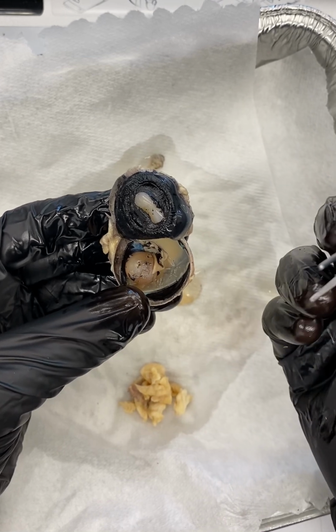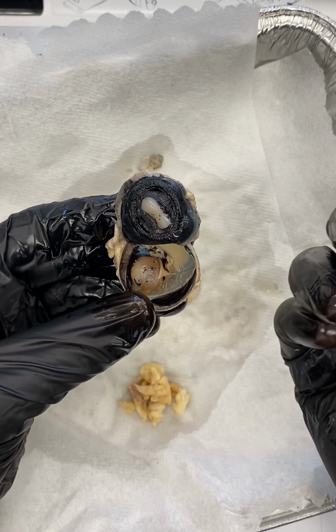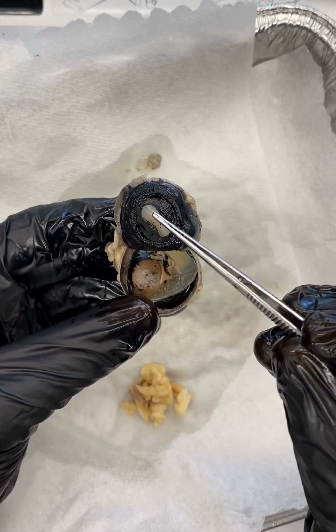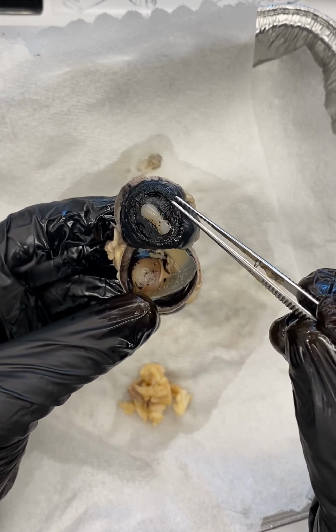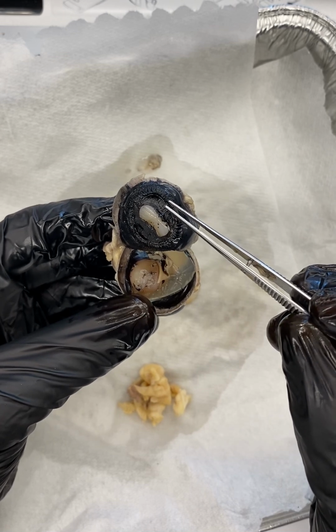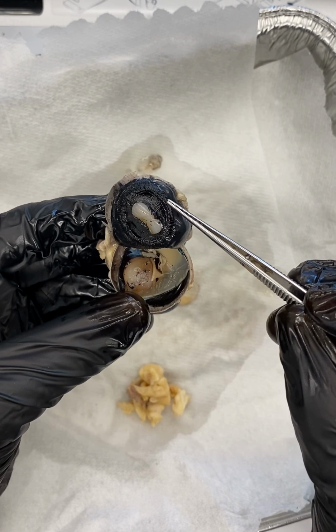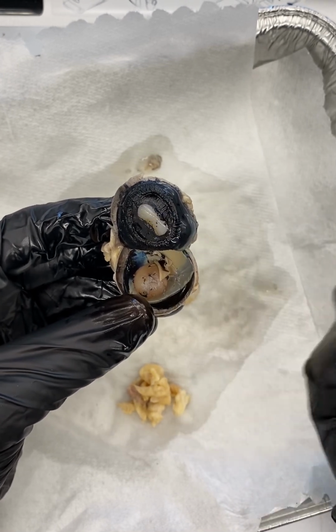And so what happens is the ciliary muscle contracts, which moves the muscle closer to the lens. These suspensory ligaments become looser, and so the lens becomes a little bit more rounded. And then conversely, when the muscle relaxes, it moves away from the lens, it pulls on the suspensory ligaments, and that causes the lens to become a little bit more flat for distance vision, okay?